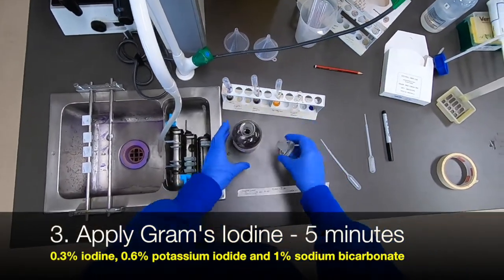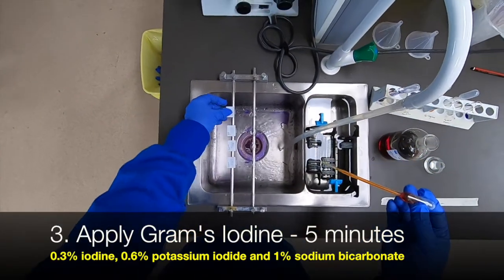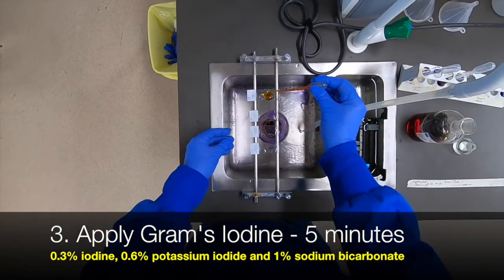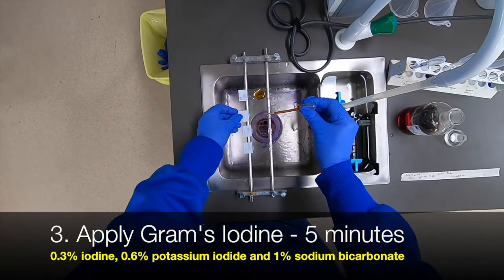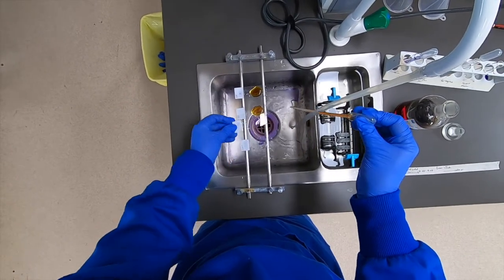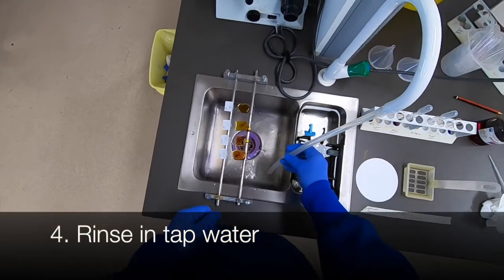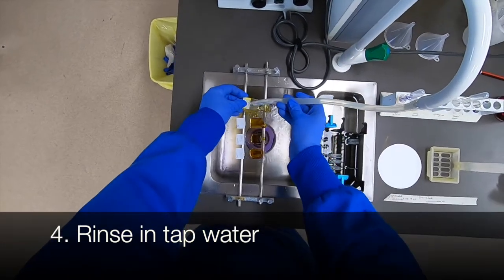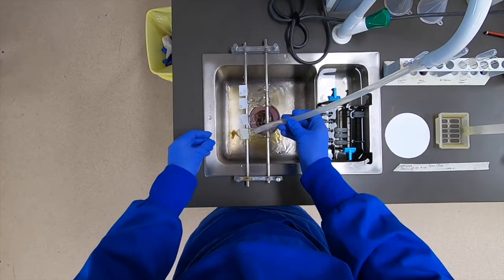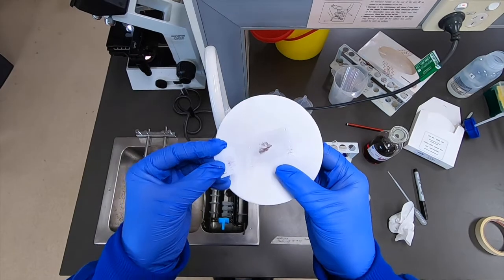We then need to stabilise the bound crystal violet by producing a complex with iodine. So we simply apply the Gram's iodine to each slide. Having done that after five minutes we rinse it off in tap water. Now if we hold one of those slides up to a piece of filter paper, we should see that it's a noticeably darker colour.